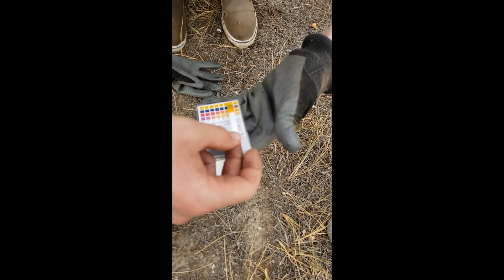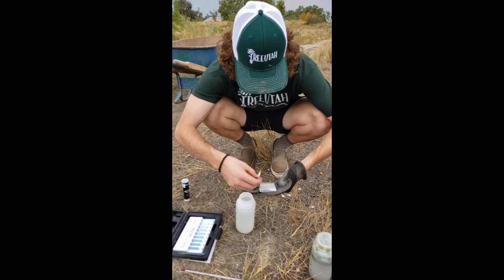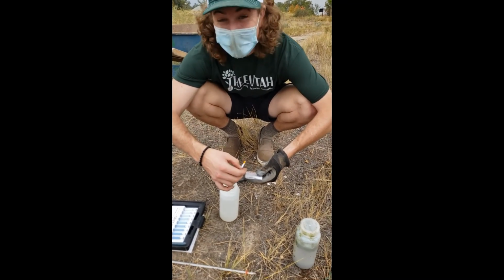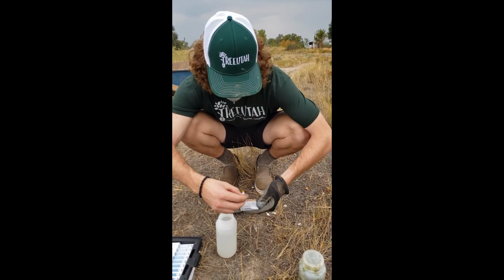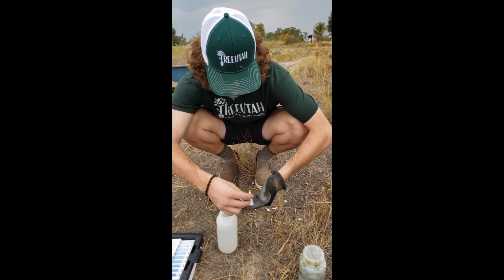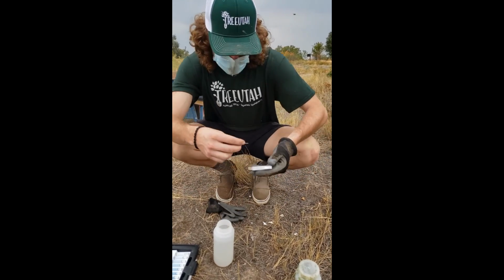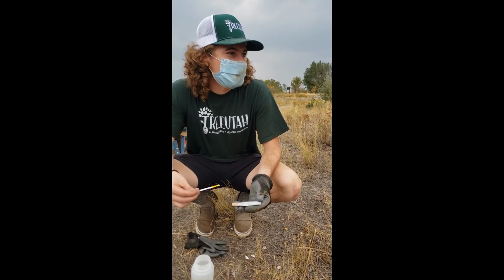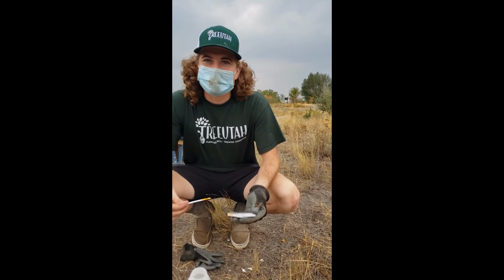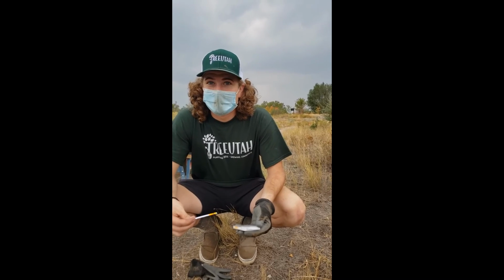I'd say it looks like it's a pH of 7. Which is neutral. And so, accept or reject your hypothesis. I reject my hypothesis, or my mostly educated guess. The water is a pH of neutral. So what's the conclusion behind that? What's that mean to you? I think it makes sense that it's neutral because most organisms want to have a pH where they're viable, and for the most part, that would mean a neutral pH rather than acidic or basic. Totally. If it gets way out of those ranges, things can't live anymore.